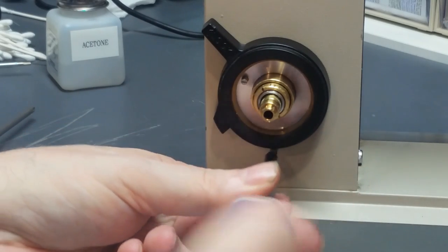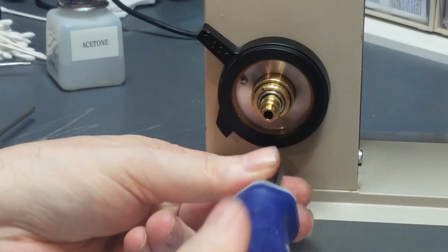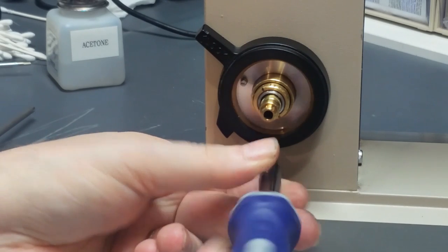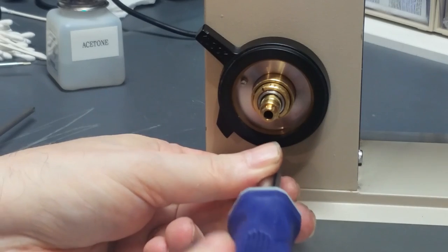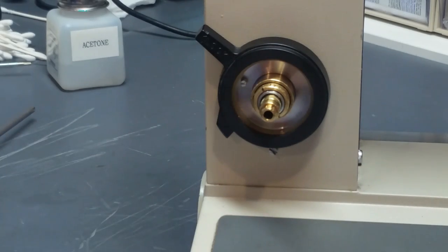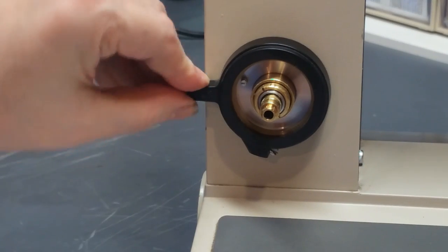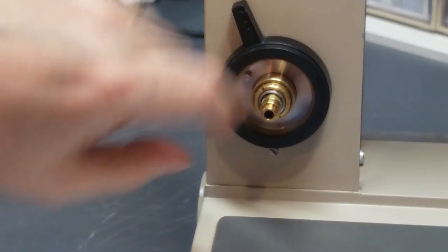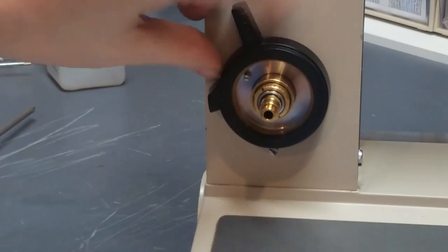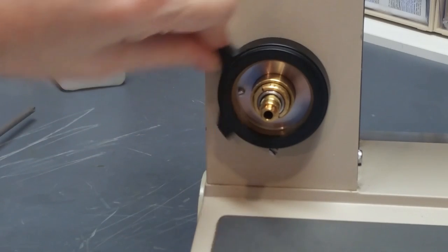Okay, I got the thread engaged, now it's just a matter of tightening it down. Okay, so that hits up against that stop, snugs down nice here. When it's snugged, it really should be in that position right there. So I believe that's ready to go.